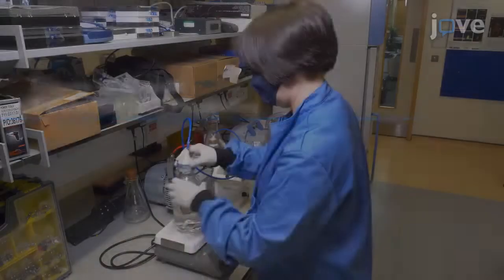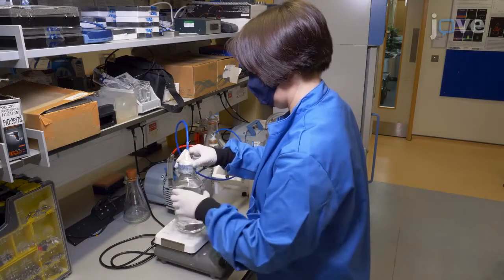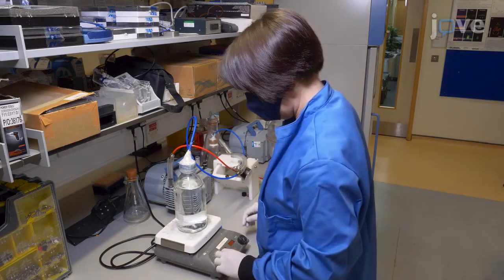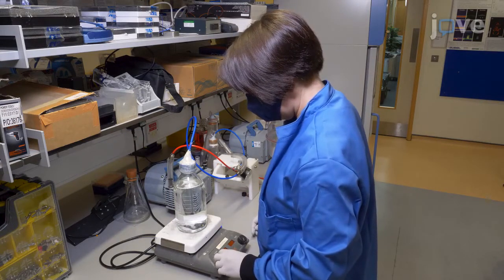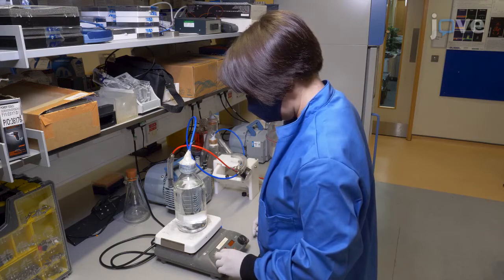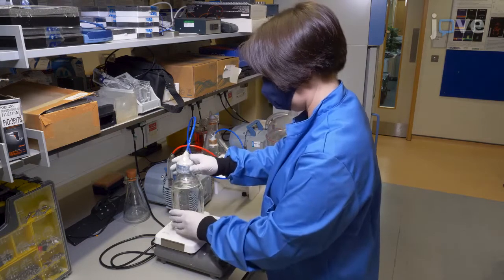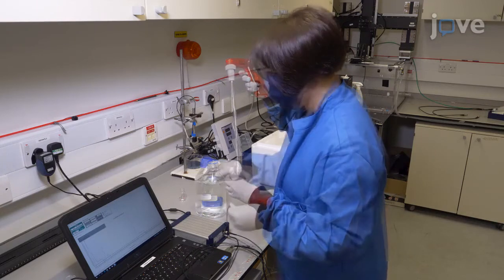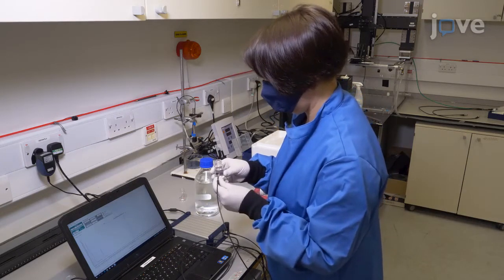For preparation of the systems for acoustic transfection, degas the fill liquid under a pressure of -100 kilopascals for at least 2 hours to minimize the likelihood of cavitation in the propagation path. Confirmation with a dissolved oxygen probe that the partial pressure of oxygen is below 10 kilopascals is recommended.